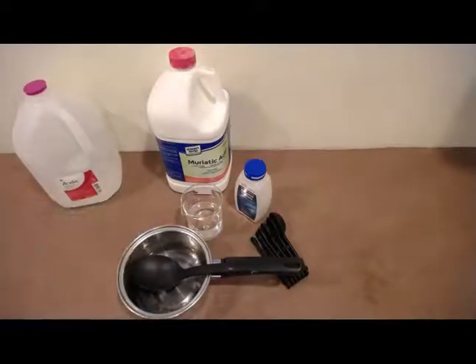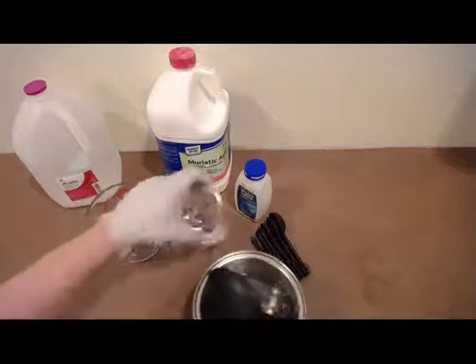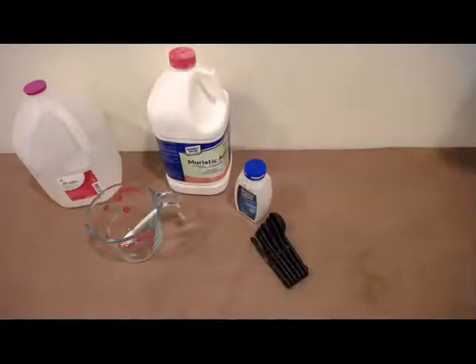Okay, so we're going to rinse those. I'm going to rinse and dump in the sink here. And again with these items.